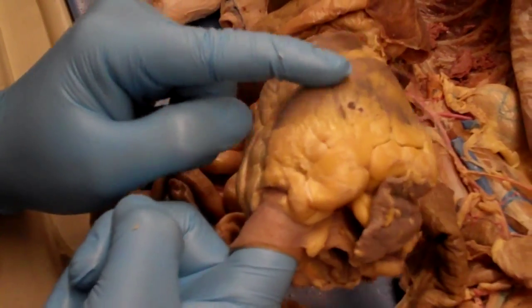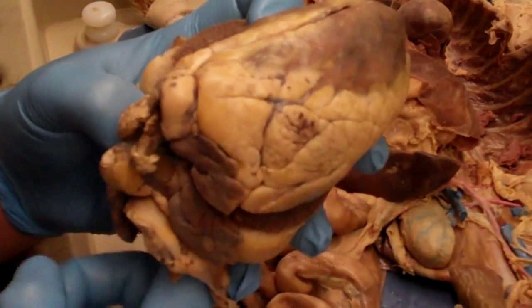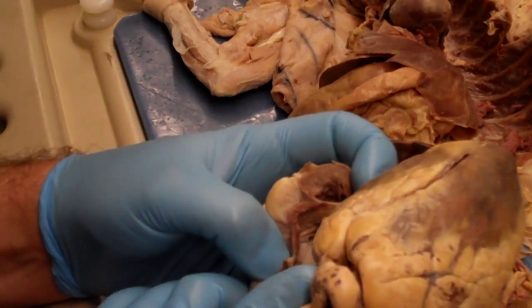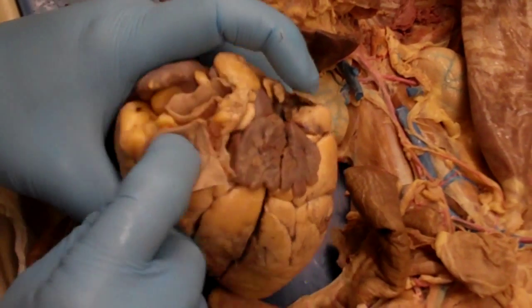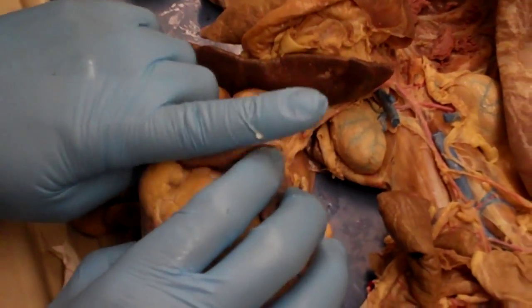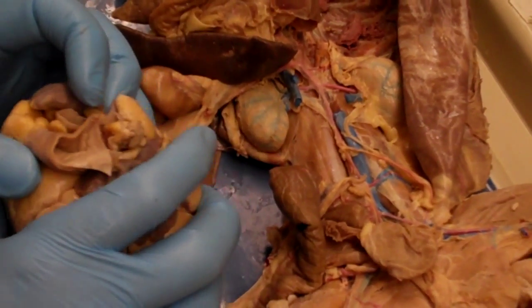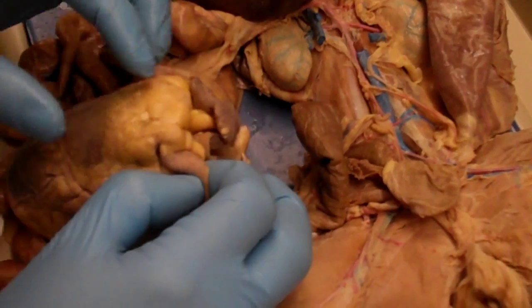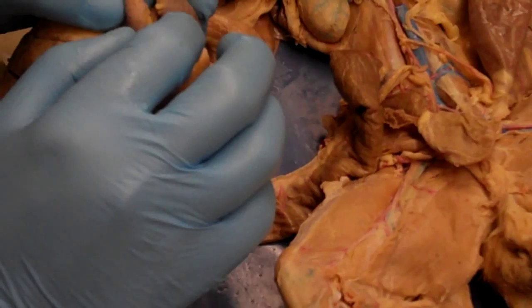And we can already see the tip of my fingers right there, which we know is the right ventricle. If we open this guy up, we can actually physically see it in there. So I know that this hole has to be the pulmonary trunk. And what happened is, if there was a couple more centimeters of that, it would have come out and then split into the left and right pulmonary artery. But at this point, all we have is the right ventricle with the single tube coming out of it, which is going to be the pulmonary trunk.